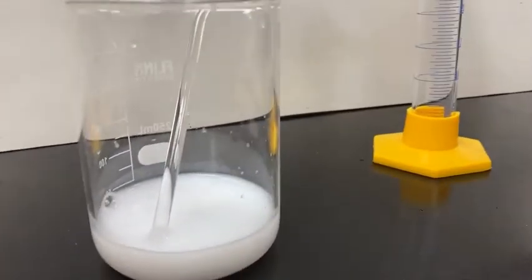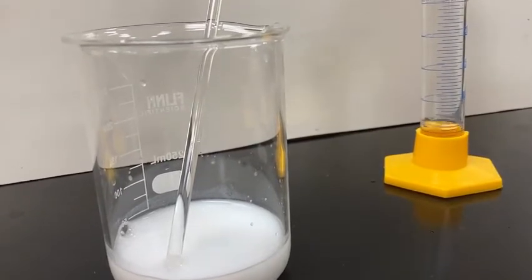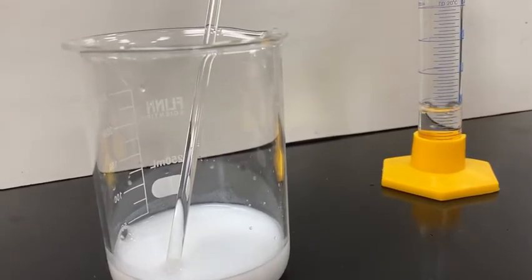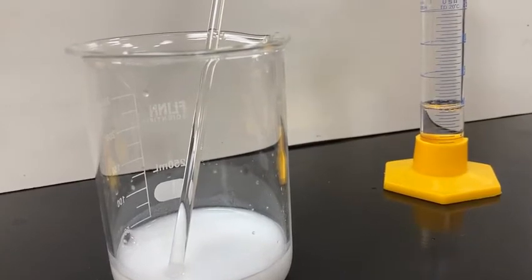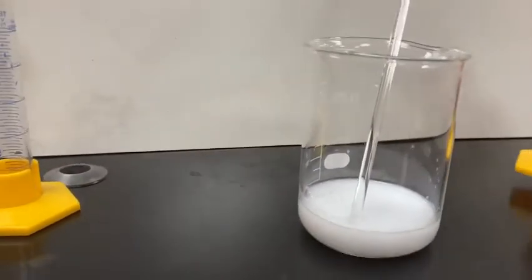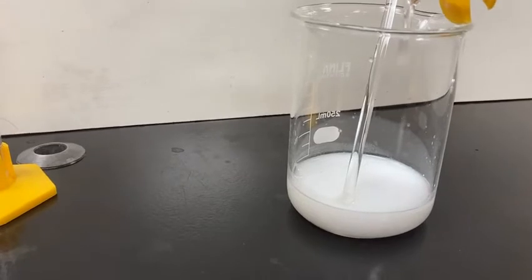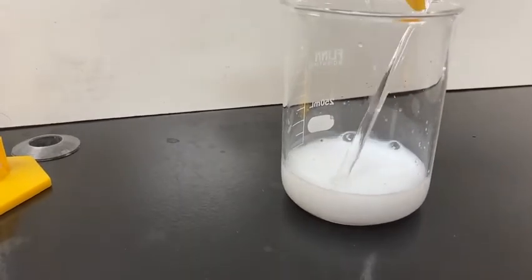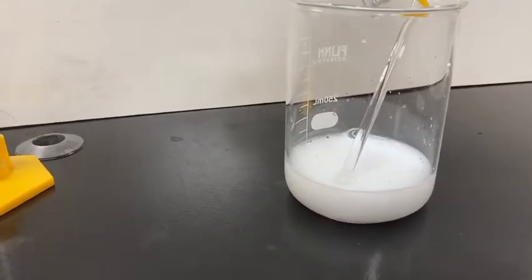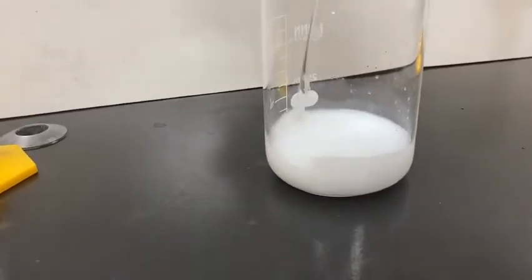And to that, I'm going to really make sure all that sodium carbonate has been reacted, and I'm going to add an additional 10 milliliters, or thereabouts, of extra strontium chloride, really making it the excess reactant. So I'll dump that in. If there was any unreacted sodium carbonate in there, it is reacted now. And I'm going to mix it.